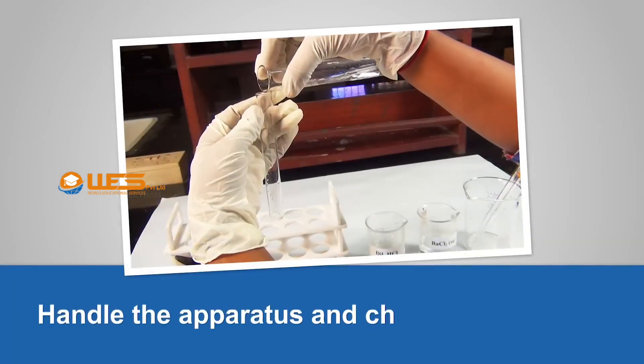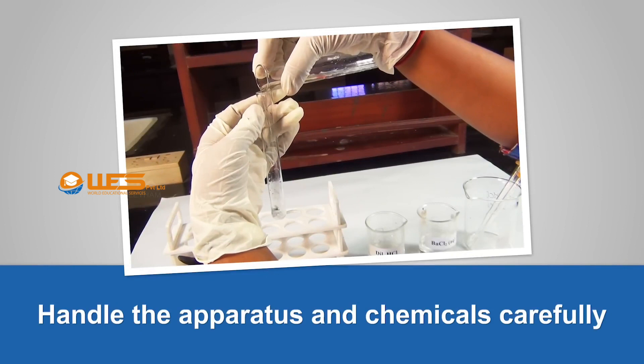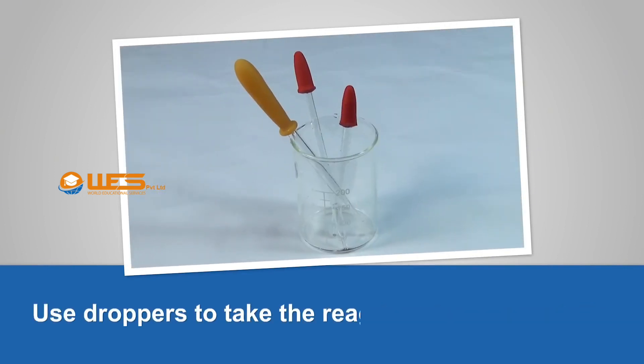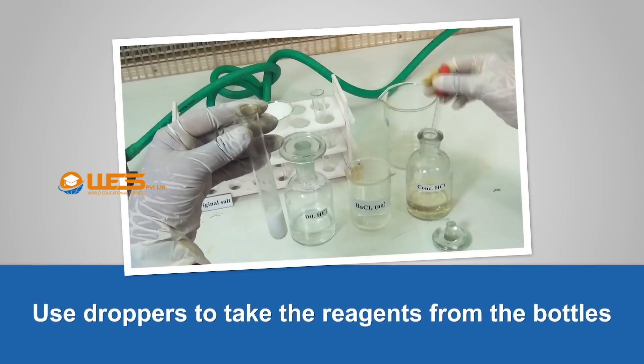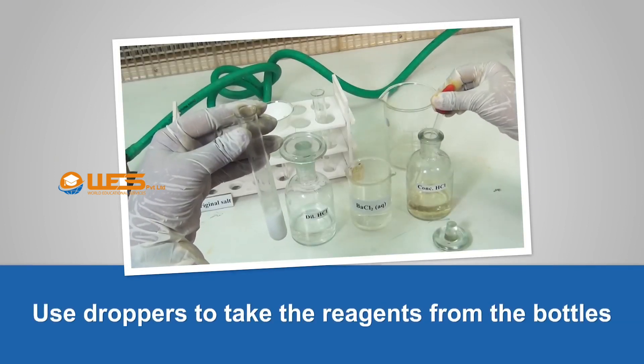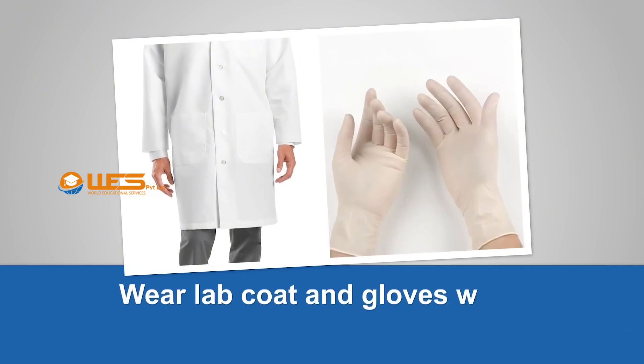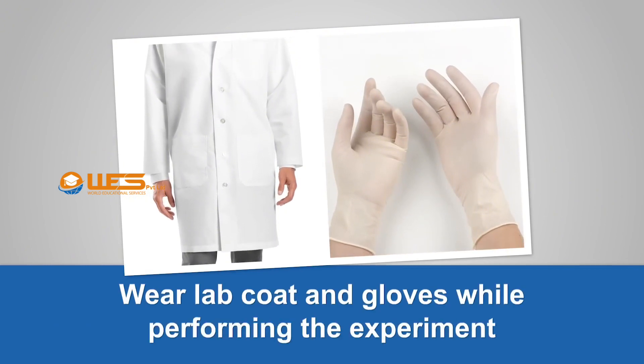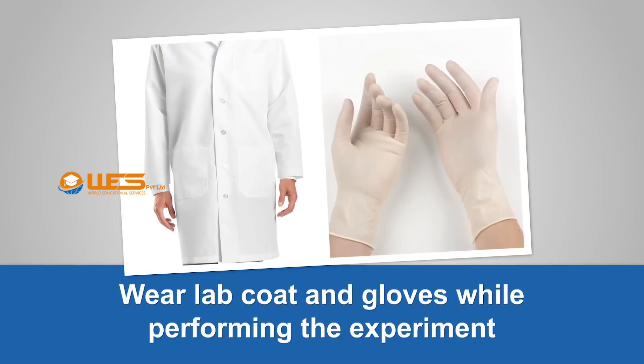Precautions: Handle the apparatus and chemicals carefully. Use droppers to take the reagents from the bottles. Wear lab coat and gloves while performing the experiment.